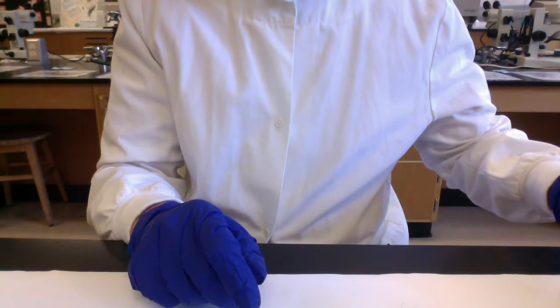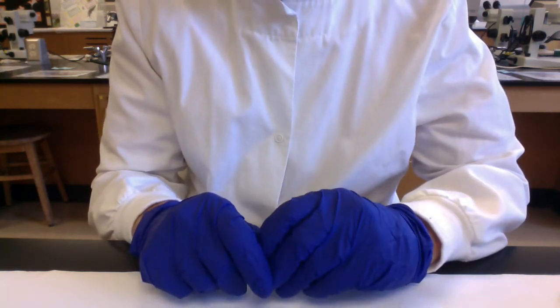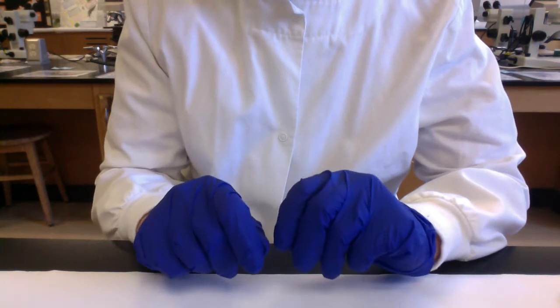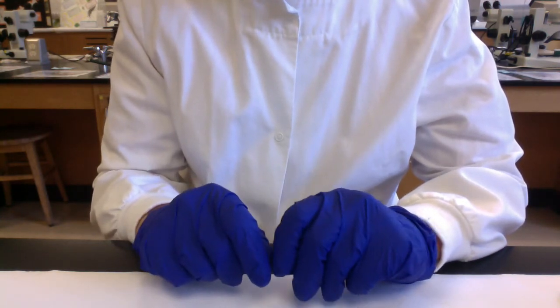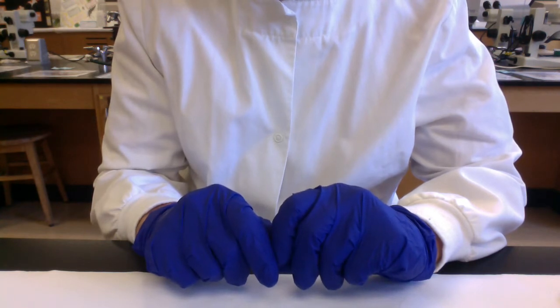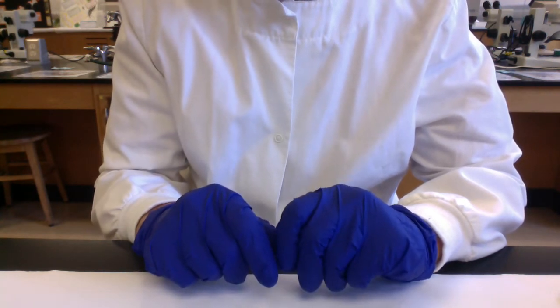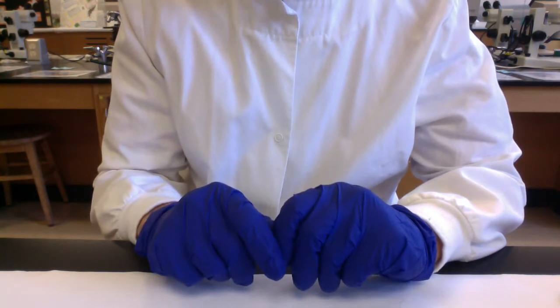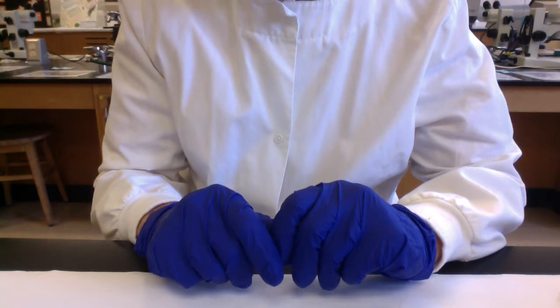We have set up the experiment so that we're going to expose one set of plates. Well, actually, there's 3 time exposures. One set of plates, we will leave the lids on. That's the 0-minute exposure. That's our negative control to make sure our medium was sterile to start with, right? There was no contamination. And then a second set of plates, we'll take the lids off for 30 minutes, and then the third set of plates will take the lids off for 60 minutes.